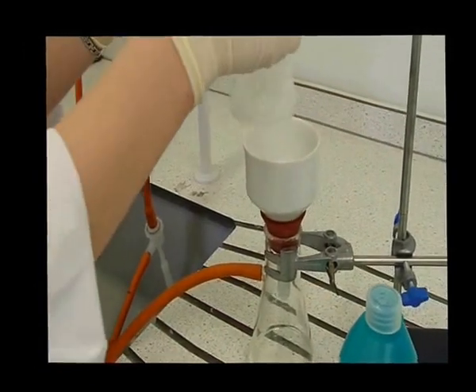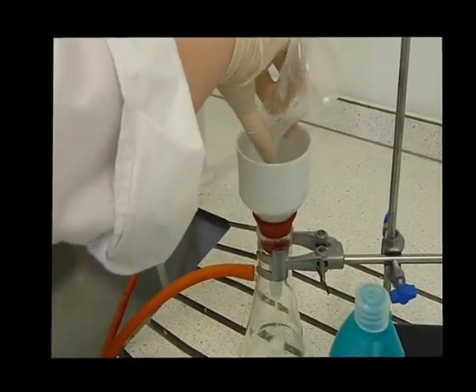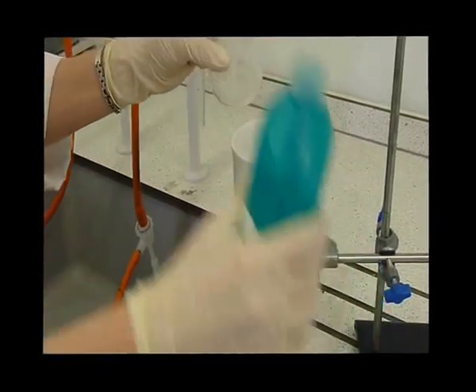Use minimum rinsings of cold solvent as necessary to ensure that all the contents of the conical flask are transferred to the Buchner funnel.